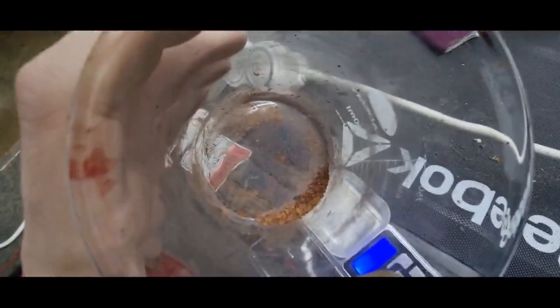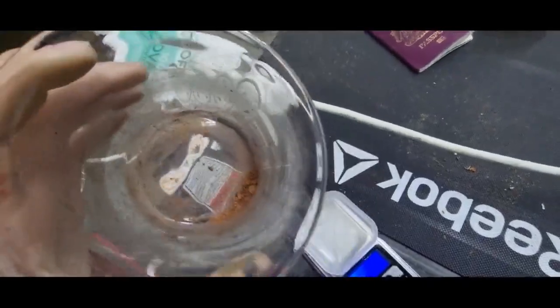So here we have the gold here. It's not the purest and I will be doing a video soon where I show how I purify even further. But we'll weigh it up and see what we've got.